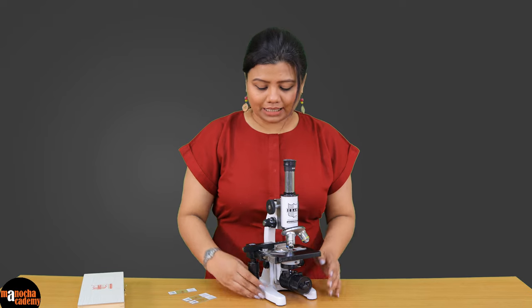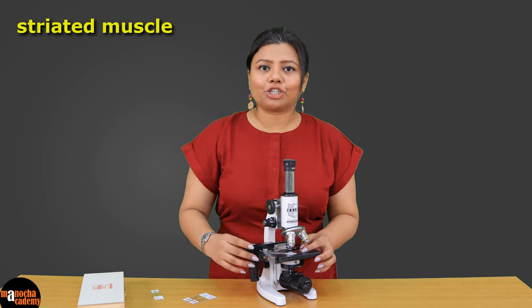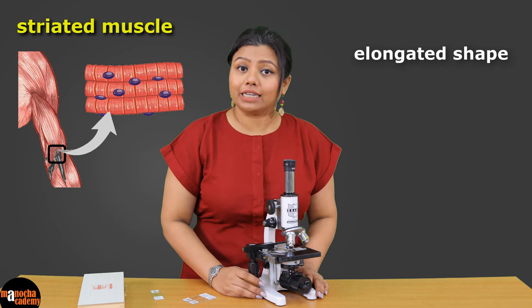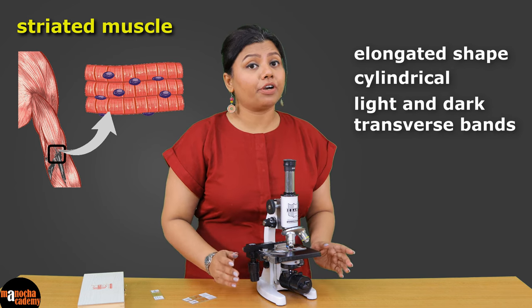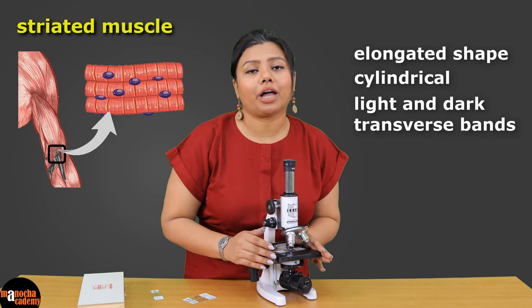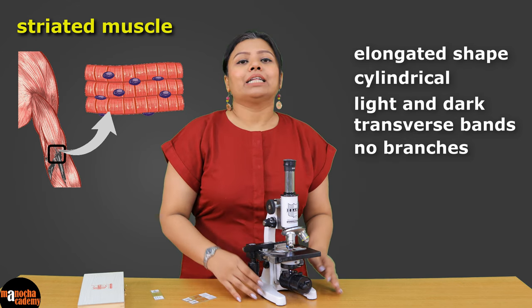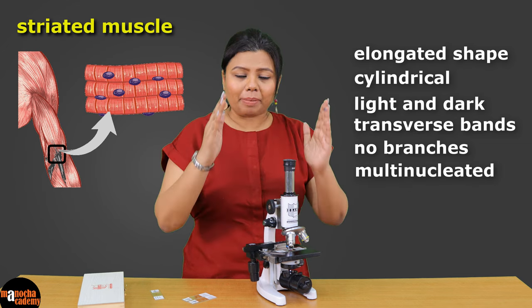We move on to the next muscle which is striated muscle. These muscles are attached to our skeleton and are therefore also known as skeletal muscles. They are elongated and cylindrical in shape with alternate light and dark transverse bands, though you will not be able to see these bands under this magnification — you need much higher magnification for that. What you will see are elongated cells similar to cardiac cells, but they are not branched. They are multinucleated and the nuclei are located towards the periphery of the cell.